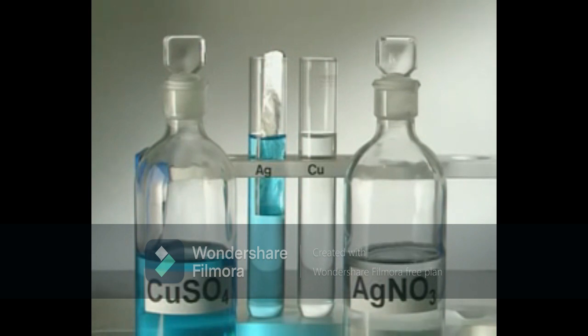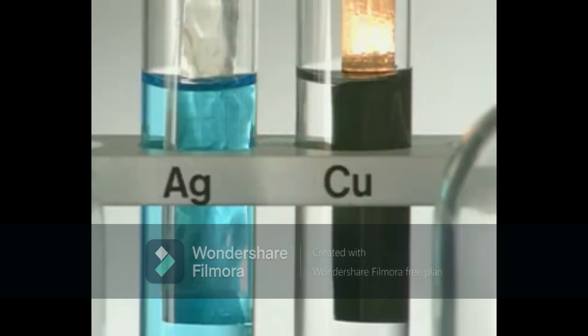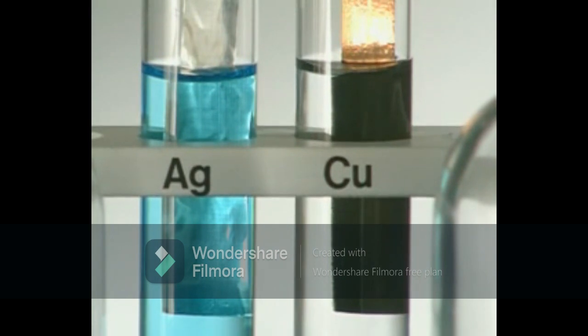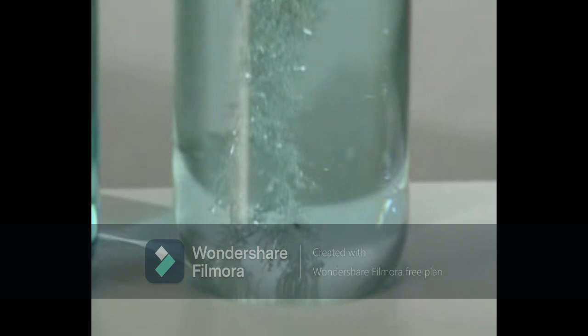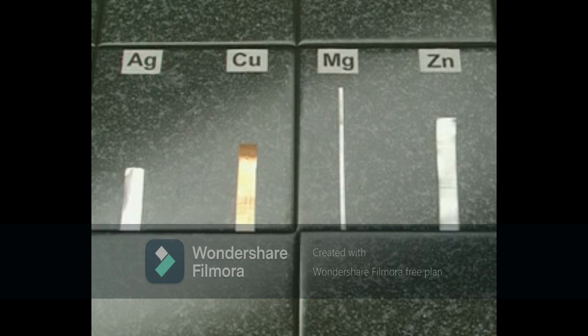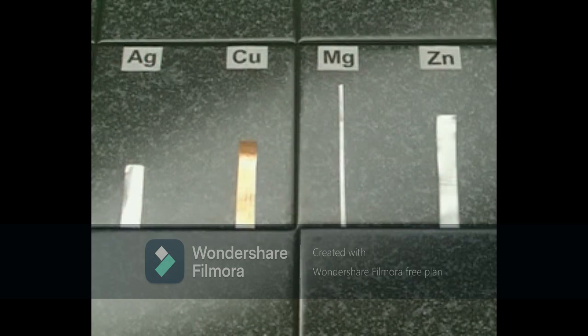Silver is placed in a copper solution, and copper in a silver solution. The silver strip doesn't react, but the copper immediately displaces the silver. You can actually see crystals of silver growing on the copper strip. After several hours, there's so much silver it glistens, and the colourless solution is starting to go blue. So, magnesium is the most reactive and silver is the least. What would happen if you placed a strip of magnesium into a solution of silver nitrate?